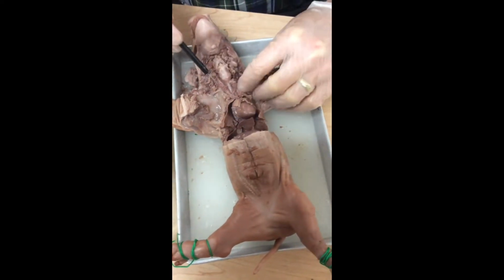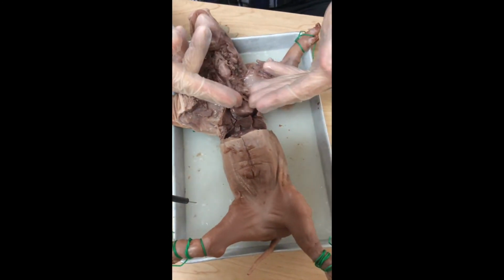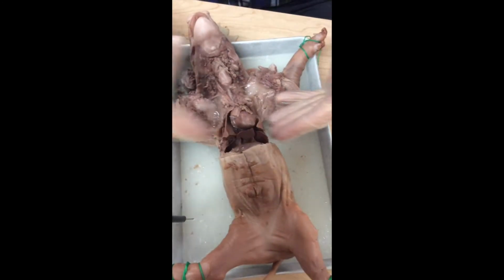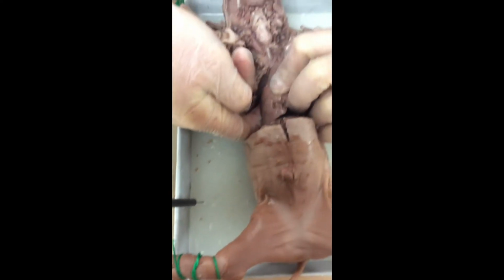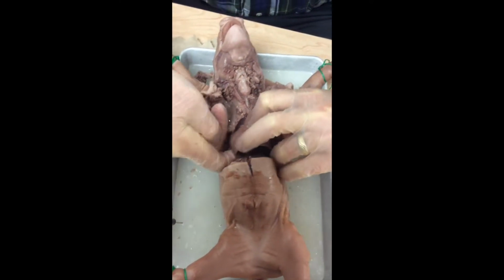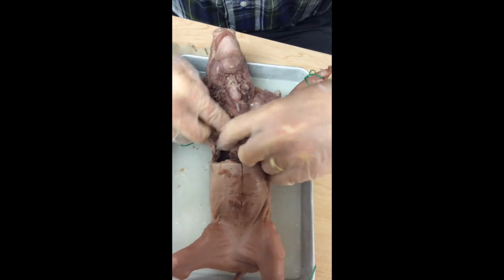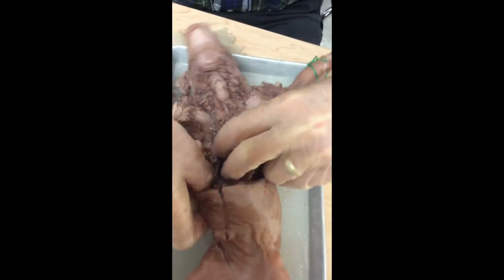All right, I'm going to do a couple of things right now. I'm going to take out the heart and the lungs. So this is something I'd like you to do in class. That'll be the first thing that you're going to do, is you're going to dig out the heart and lung. Now, to do this, I'm going to use my finger, and I'm going to try to tease away the connective tissues that are holding these organs within that cavity. And when I do that, I've got some fluid there.